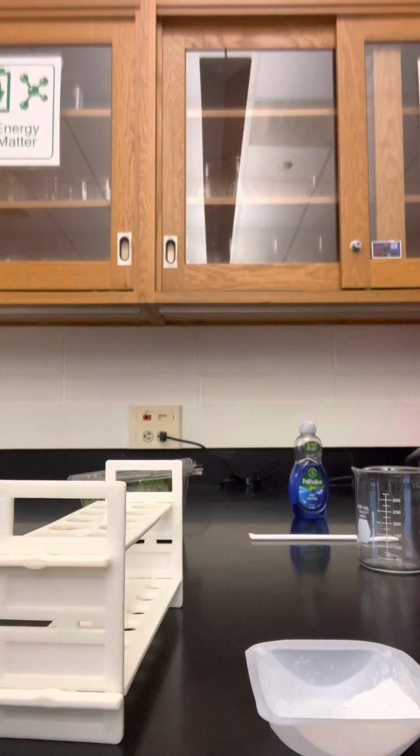This is a procedural video for the leaf disc photosynthesis lab. So the first thing you need to do when you get into your groups is figure out which variable you have been assigned. Every lab group is going to be assigned a different variable that they're going to test.